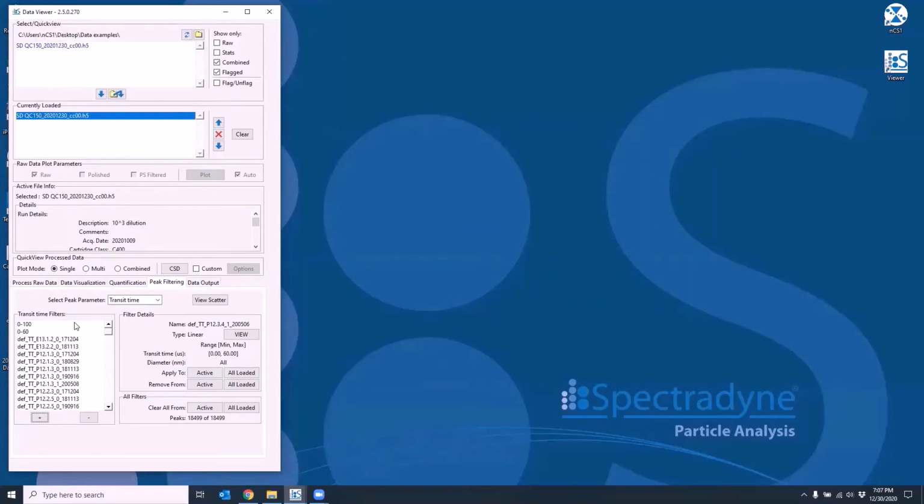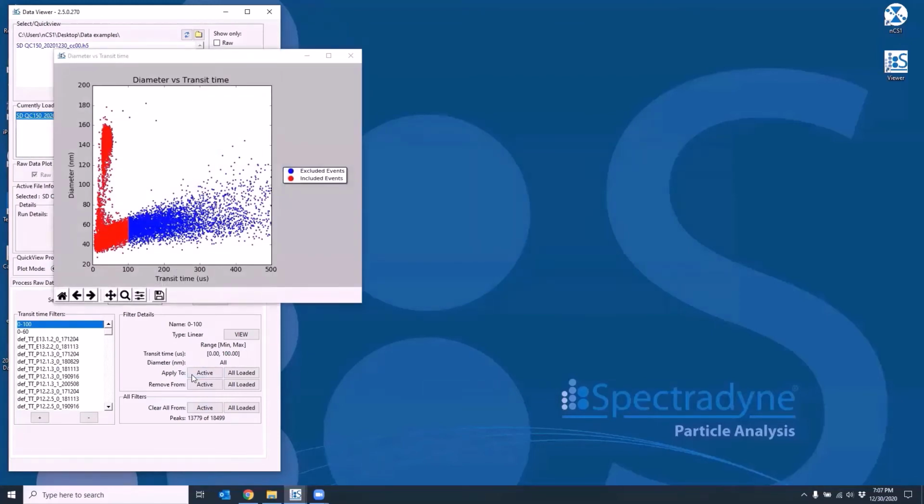The new filter will be added to the list, and you will need to find and apply this filter to the appropriate data. Plotting the updated transit time scatter plot, you can see now that due to the applied filter, anything above 100 microseconds in transit time will be excluded from the data, as noted in blue. Anything below 100 microseconds is included, which is labeled in red.